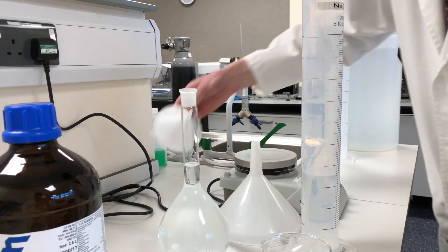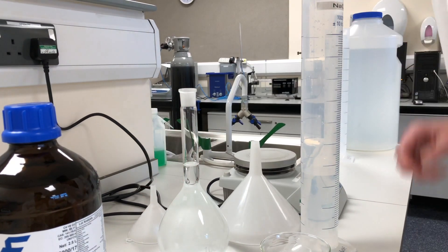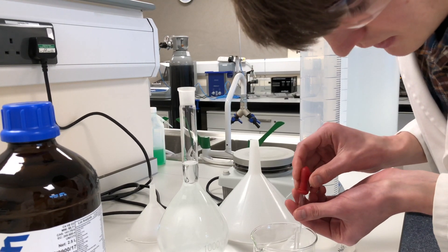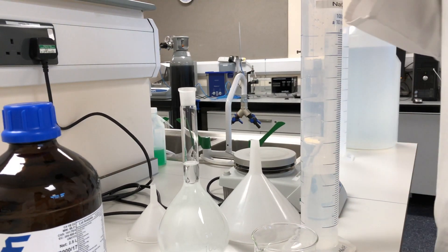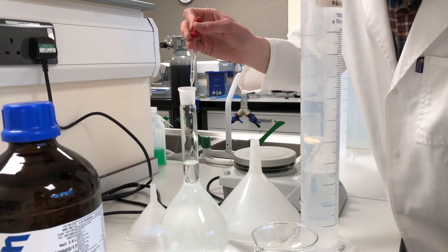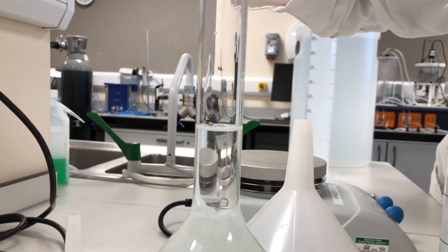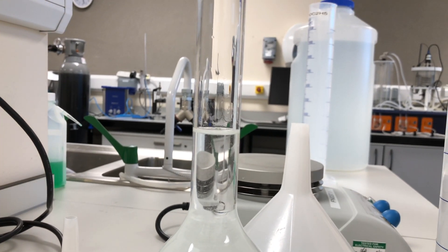How do we know once it's all dissolved? Once the solution goes homogeneous and it will become like a clear solution. This funnel here, because if the funnel's still kept there, it might still drip into it. But we want to try and be as accurate as possible. So we're just filling up a wee pipette here with more distilled water and then adding it to the flask. There we go. So we've made it up to the mark.